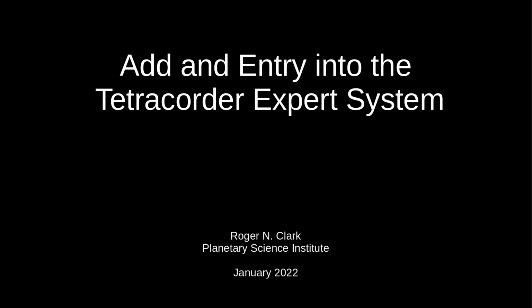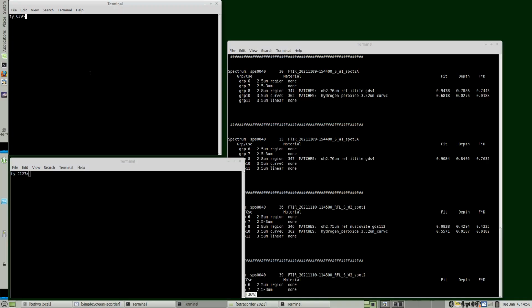In this video, I'll do an example adding an entry into the Tetracorder expert system. During the Trex Fall rover campaign, we obtained spectra with ASD and FTIR spectrometers and UV spectrometers and performed Tetracorder analyses. One of the strange things we found is shown over here.